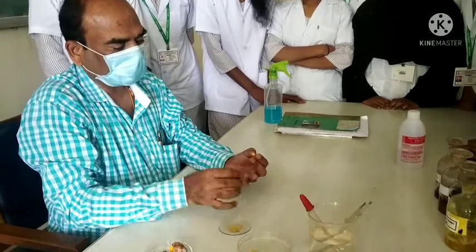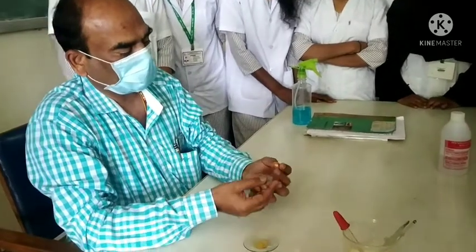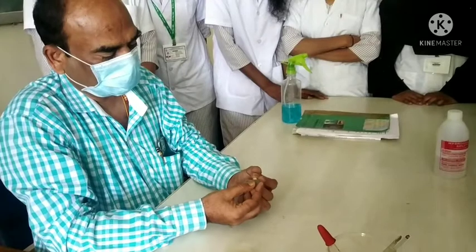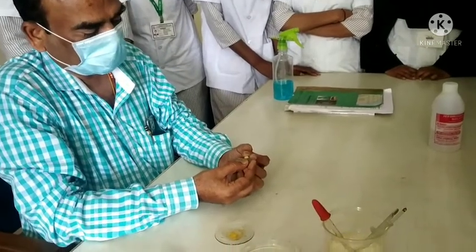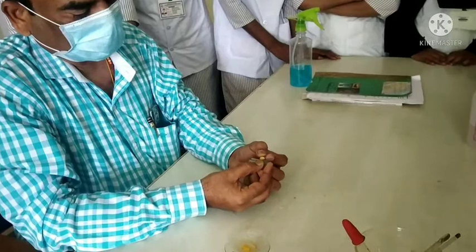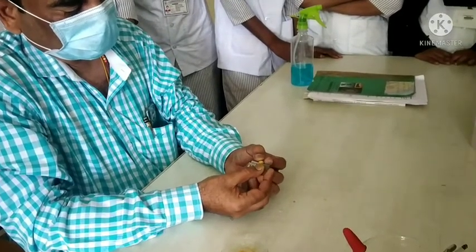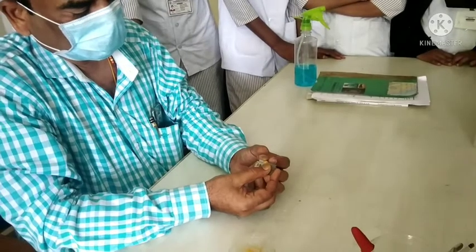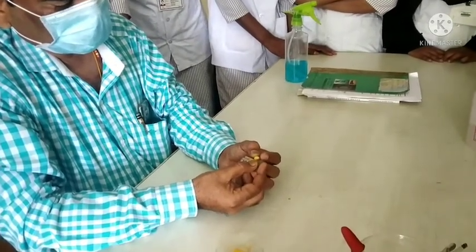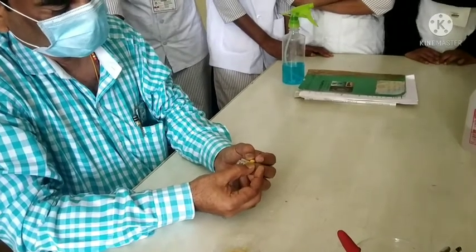Take the rhizome in the left hand and with the help of a sharp razor blade, take a thin disc-shaped, circle-shaped transverse section of turmeric in this way. With the help of a sharp razor blade, take a circle or disc-shaped section of the rhizome of turmeric.